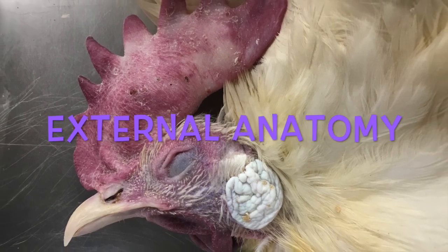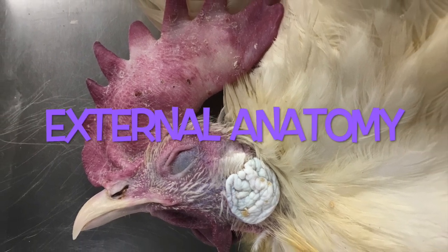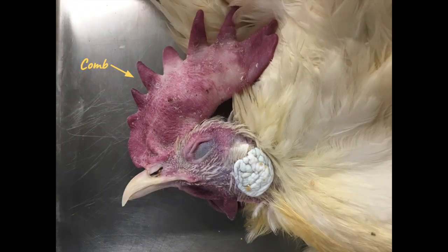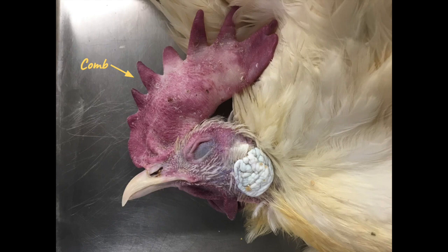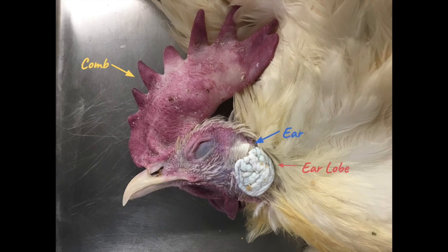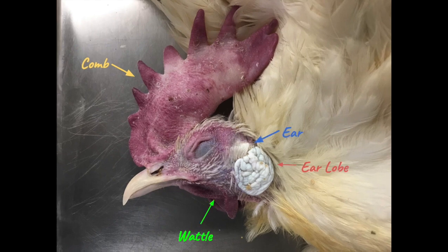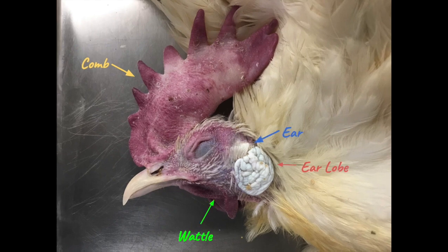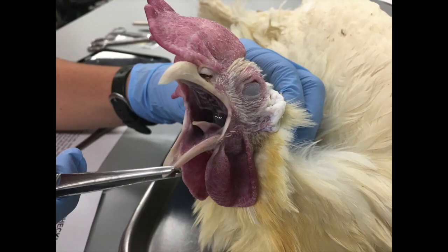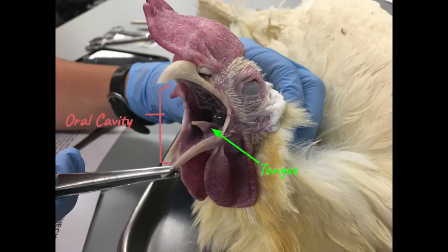Beginning with the top of the head, you can see a large red comb — this is an ornamental structure and a sexual display. Then there's the ear and ear lobe. The wattle is located under the beak and is also an ornamental structure. The oral cavity of a chicken has no teeth, and the tongue has very few taste buds.